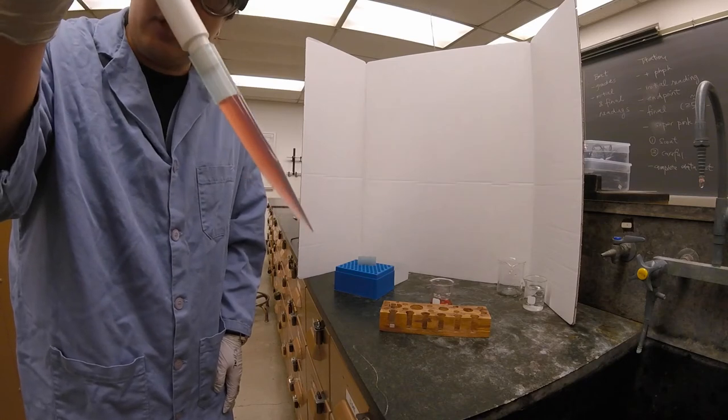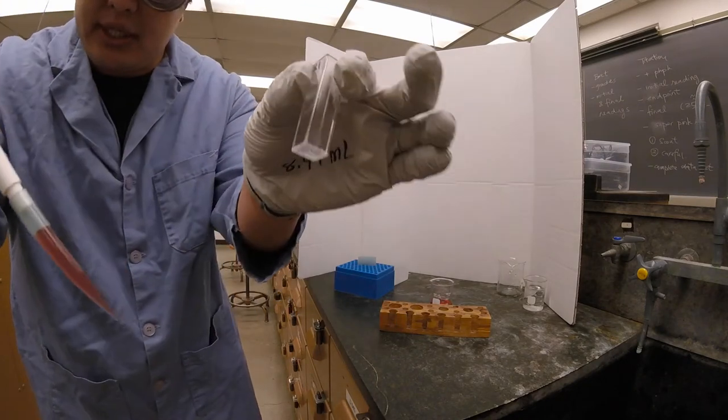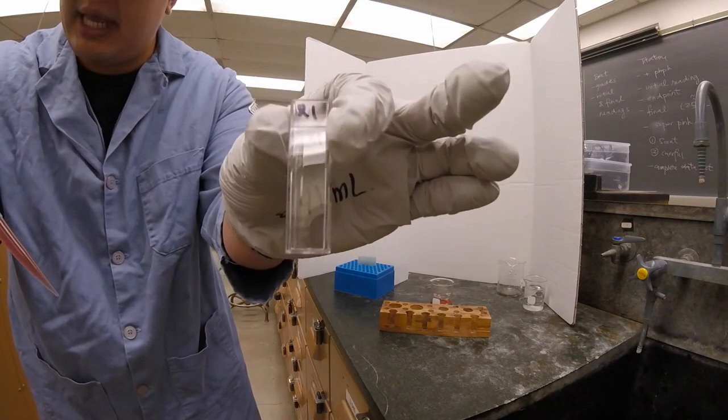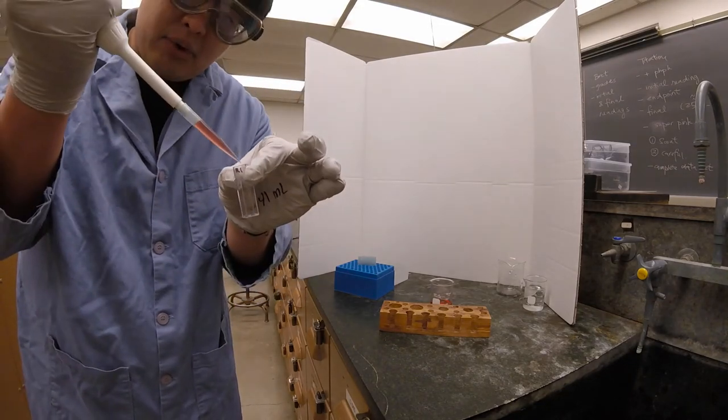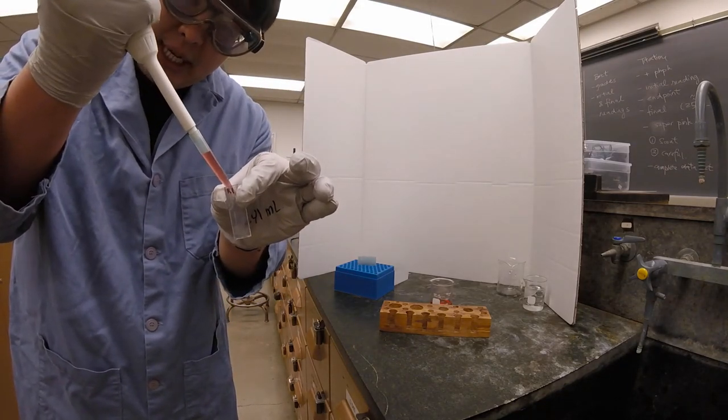So once you have it loaded up, you're going to grab your target container, which in this case is a cuvette that we pre-labeled, and we're going to deliver the liquid again slowly.